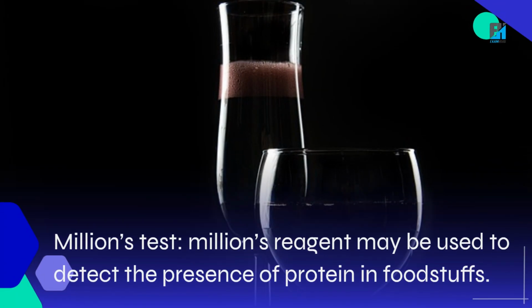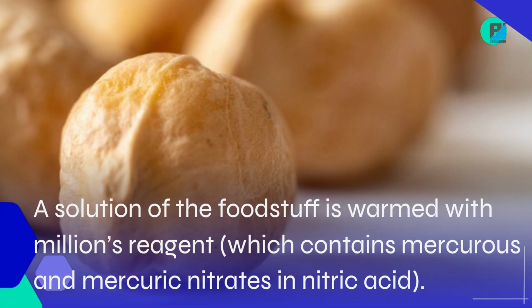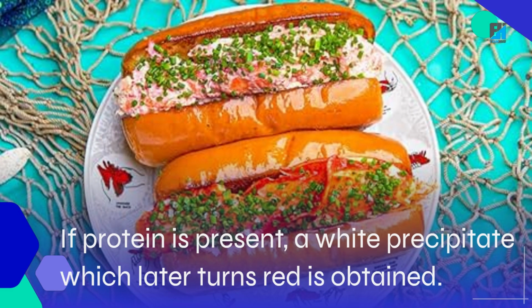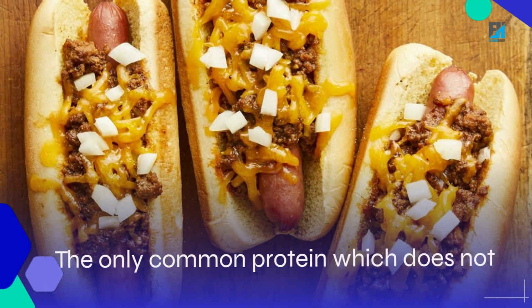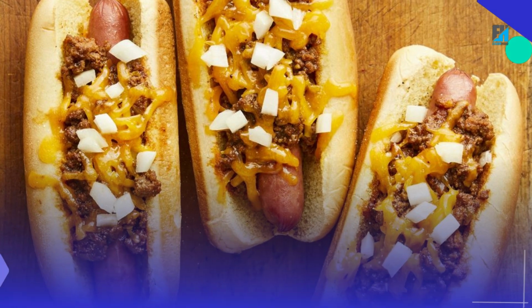Millon's test: Millon's reagent may be used to detect the presence of protein in foodstuffs. A solution of the foodstuff is warmed with Millon's reagent, which contains mercurous and mercuric nitrates in nitric acid. If protein is present, a white precipitate which later turns red is obtained. The only common protein which does not give a positive result with this test is gelatin.